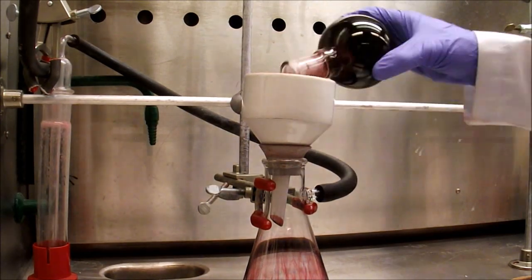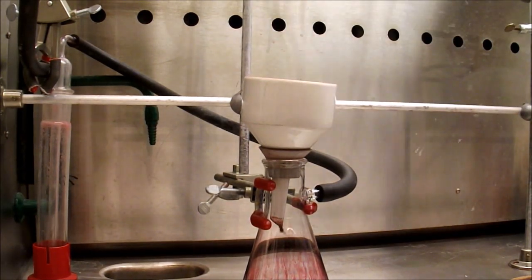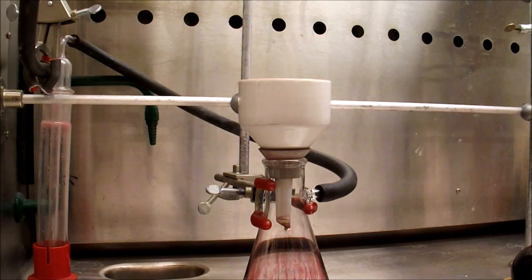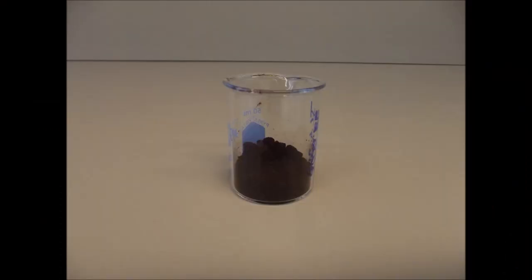We are still experimenting with optimizing the workup of this reaction further and it is possible that crashing the product out of dichloromethane with methanol is a more effective method for isolation.